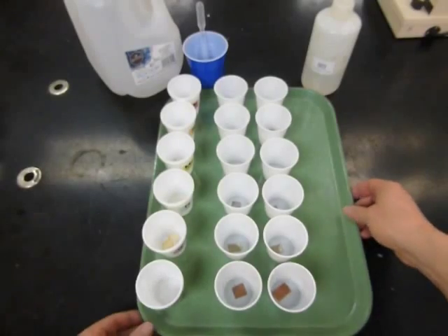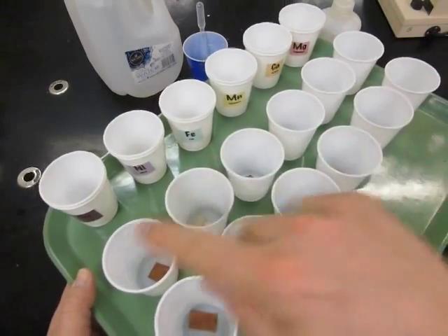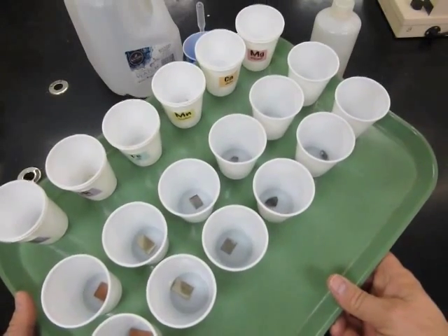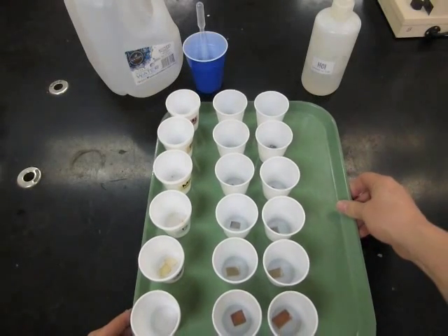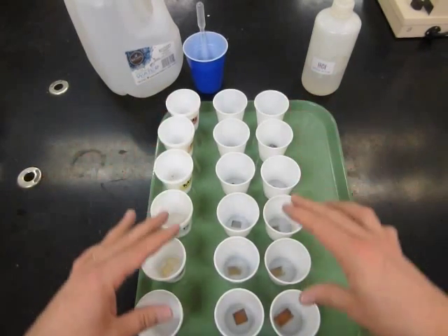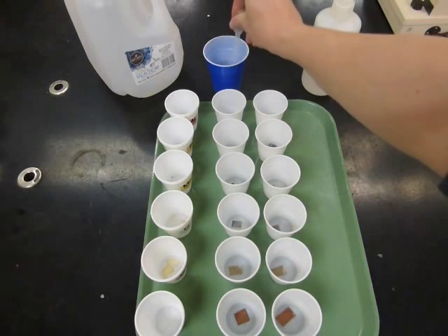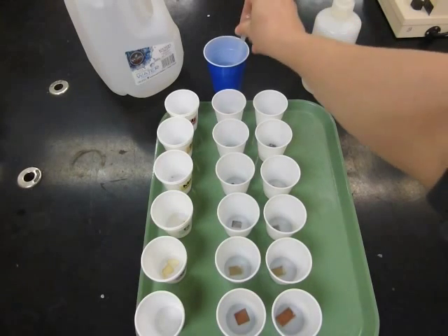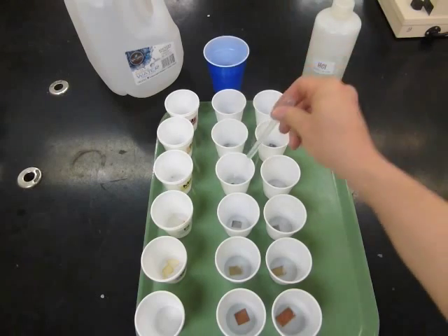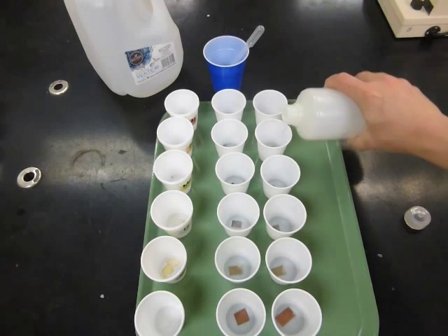I've set up my experiment with the metals magnesium, calcium, manganese, iron, nickel, and copper with sets of cups. In these cups I'm going to add water, and in these cups I'm going to add hydrochloric acid. We'll look at the surfaces to see if there's any evidence of fizz, and feel the cups to see if there's any evidence of heat. I'm going to do the first three together and look at those results, then do the last three together. I'll add just enough water to cover the metals — we still want to be able to see what's going on. Then we'll do the same with the acid.